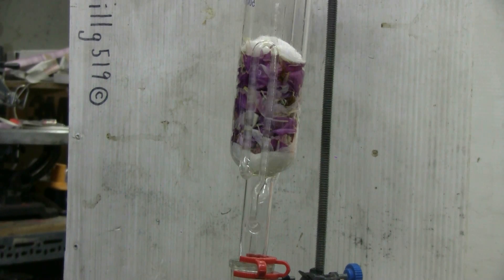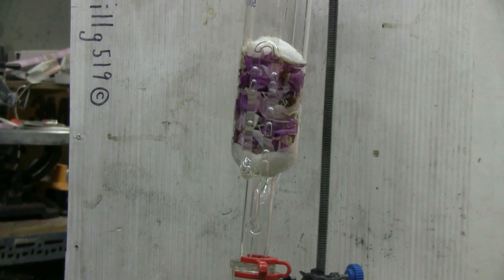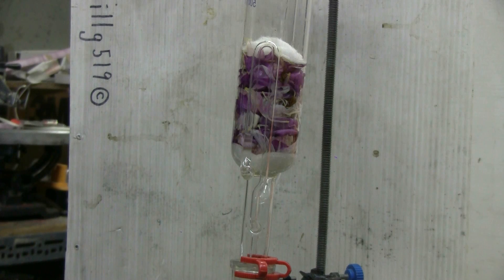The first cycle is just finishing, it can be seen draining out there, it just finished draining. The ether cycles very quickly in my Soxhlet, so to do about 10 or 15 cycles on these peony flower petals shouldn't take too long today.